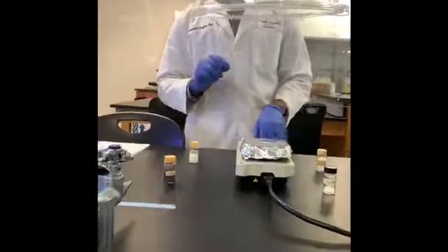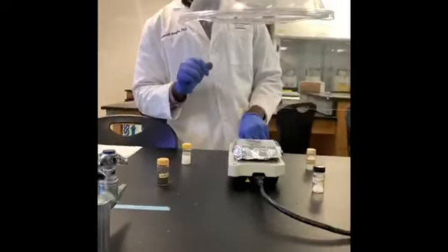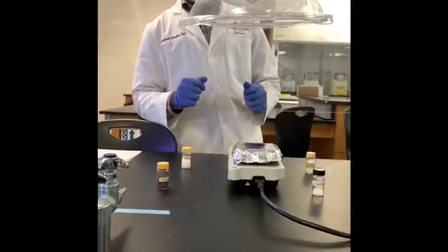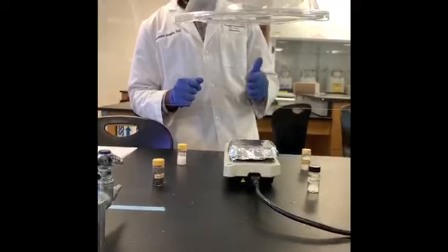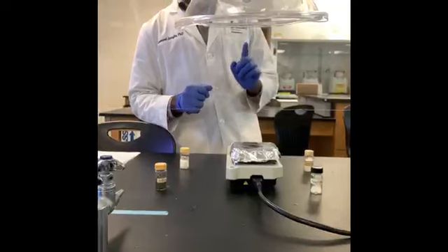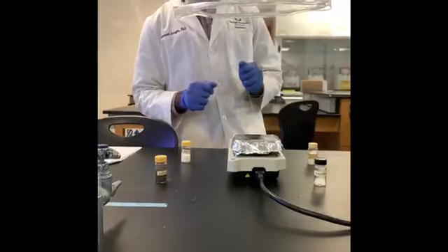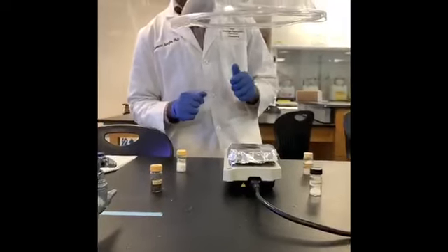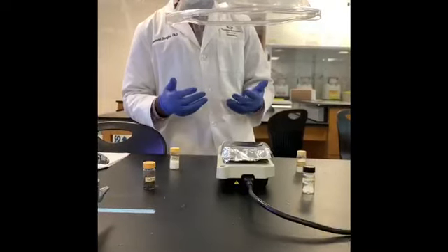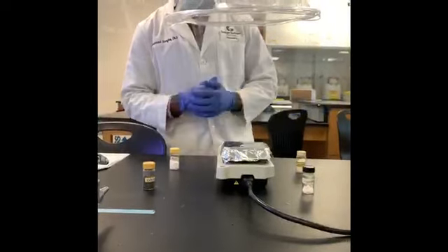Alright, so for the next part of today's experiment, which is part C, we have 4 compounds and we want to figure out which of those compounds will melt first, which will melt second, third, and fourth. The one that takes the longest time to melt will have the strongest intermolecular forces. The one that melts first has the weakest intermolecular forces. So through this procedure, we're going to verify which of these compounds will have the strongest intermolecular forces, which have the weakest. That's what we'll have to do here.